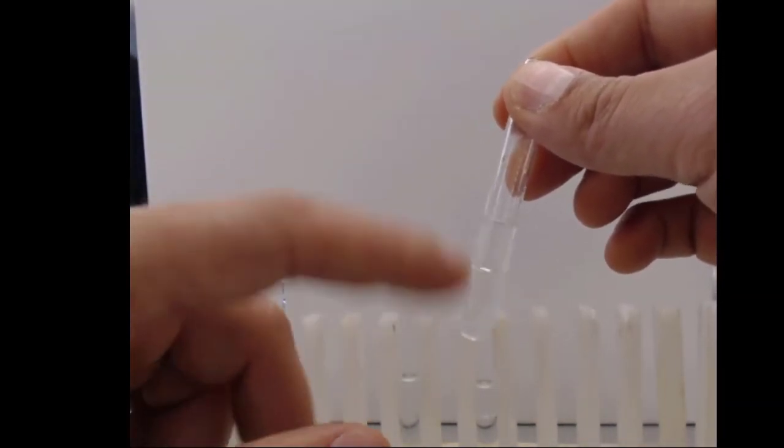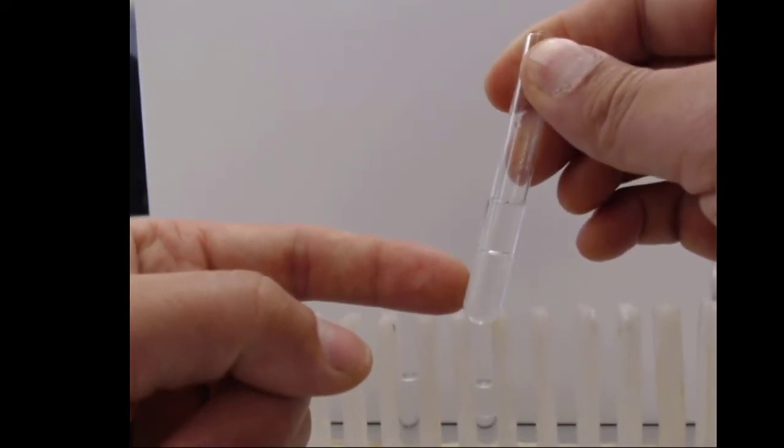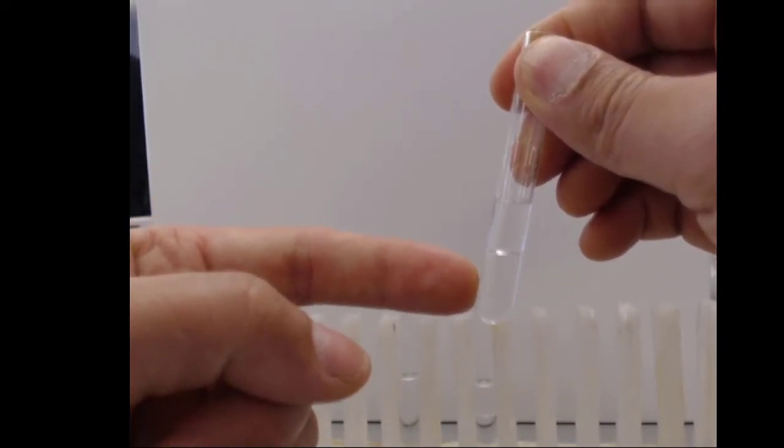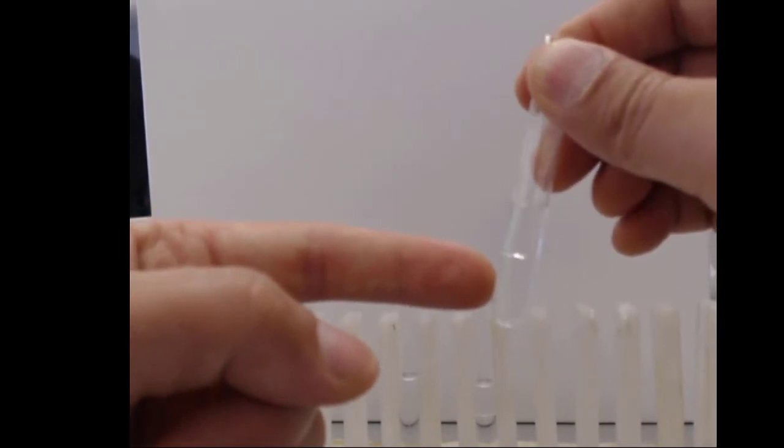Even though it has a permanent dipole moment, this compound still doesn't mix with water because of the energetic interactions, considering the dipole-dipole interaction versus the dipole-London dispersion force interaction. And we can also see this type of idea in a more measurable way by looking at gas chromatography. So the next thing we're going to do is look at a gas chromatograph, which takes a little bit of setting up.